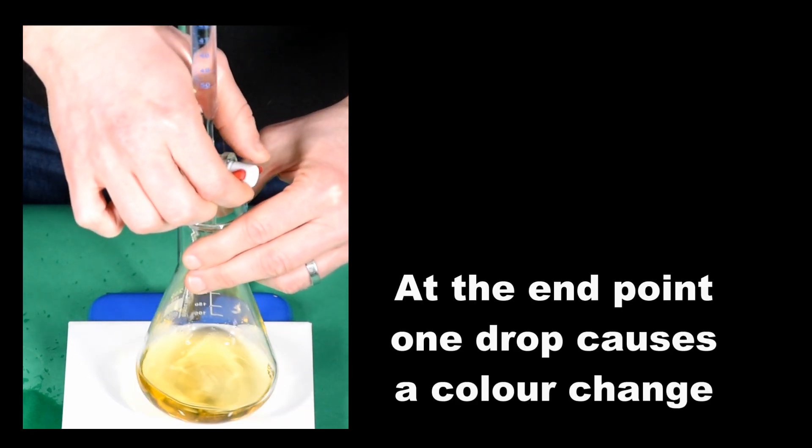If you're adding the acid slowly, it seems to take a very long time, but it needs to be done slowly and carefully. The colour changes become more frequent and obvious as you get closer and closer to the end point.